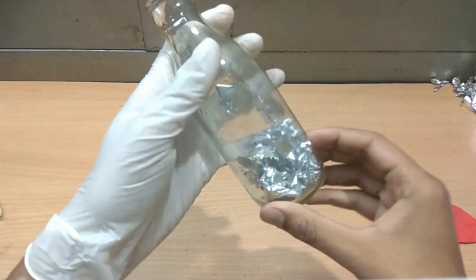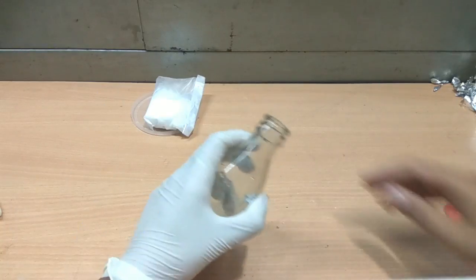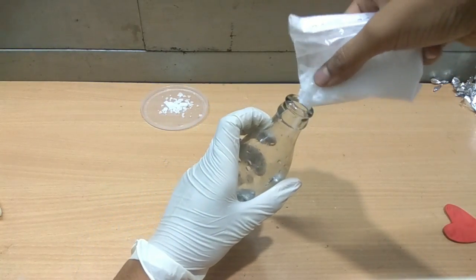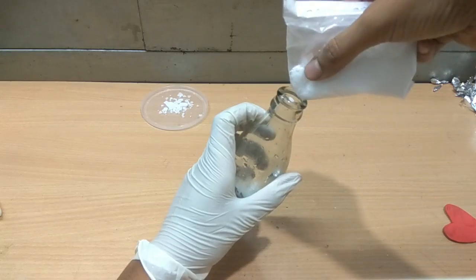Now put a small amount of NaOH into the water. Be careful while adding this and avoid direct contact with skin, as this chemical is highly basic in nature. Now add some decent amount of water.